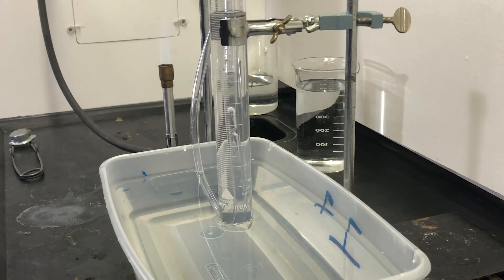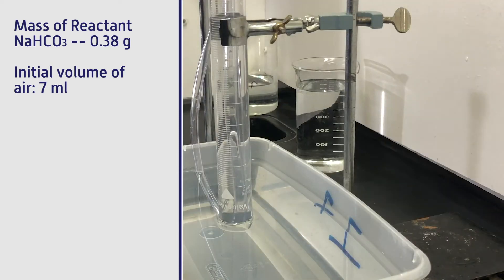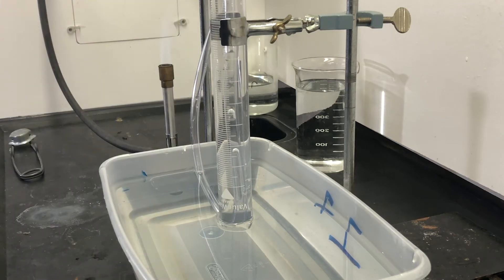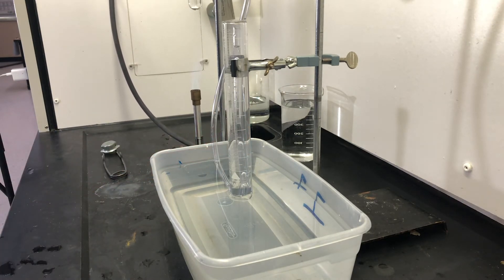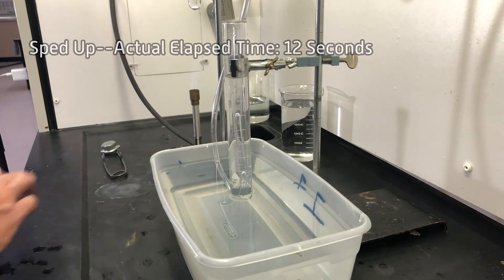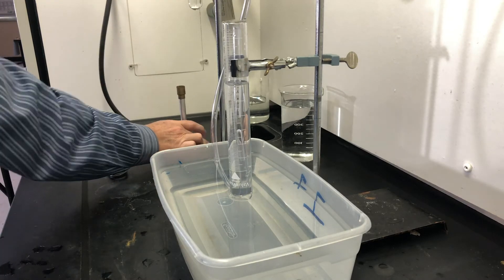After we have the setup, now we're actually collecting the results at this point. So if you're doing this lab virtually, you can begin to record these numbers. We had 0.38 grams of the reactant to begin with, and we had an initial volume of 7 milliliters of gas. I'm going to raise the burner up just a little bit and rapidly heat it for just a couple of seconds to get that reaction temperature up. We're at about 35 milliliters of gas collected. I'm going to turn off the gas.